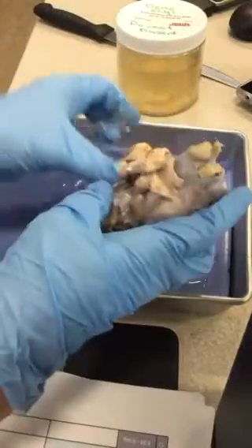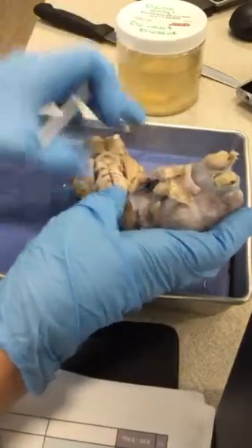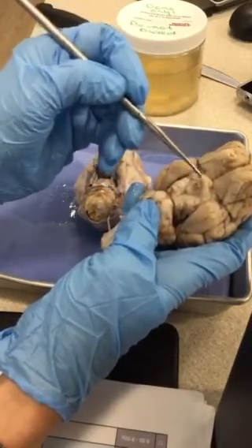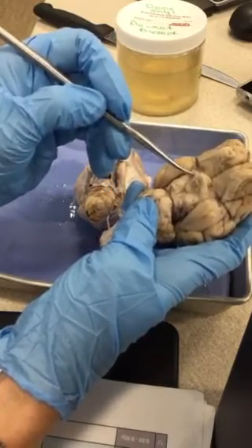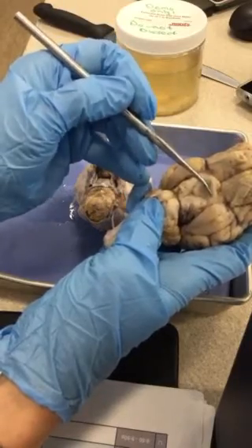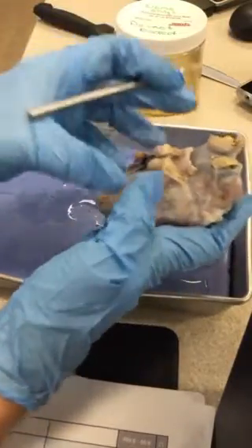So going back to this guy here, there's that X-like structure here. The top of the X on either side is the optic nerve. And then where they cross over, I'll go back to this one because that one's covered by Dura. So these have been cut, but the optic nerves would be coming off here. And then where it comes down, this is the optic tract. And then right in the middle of that X is the optic chiasma. So optic tract, optic nerve would be there, again, shown better here. Here's the remainder of the optic nerve, and optic chiasma in the middle.